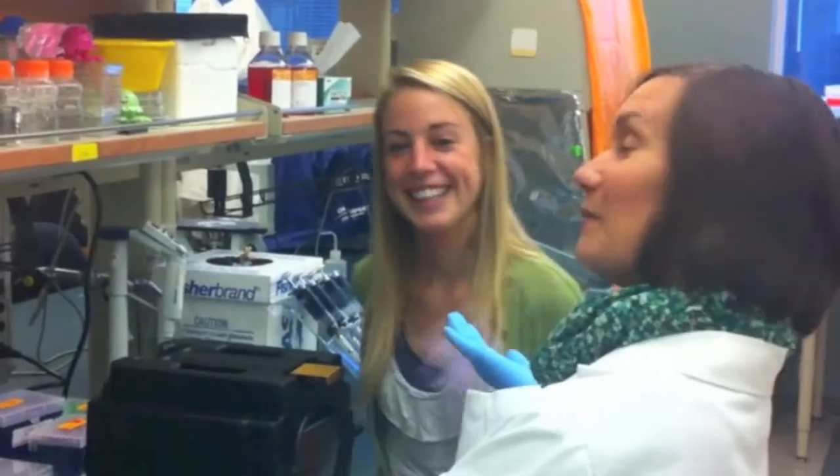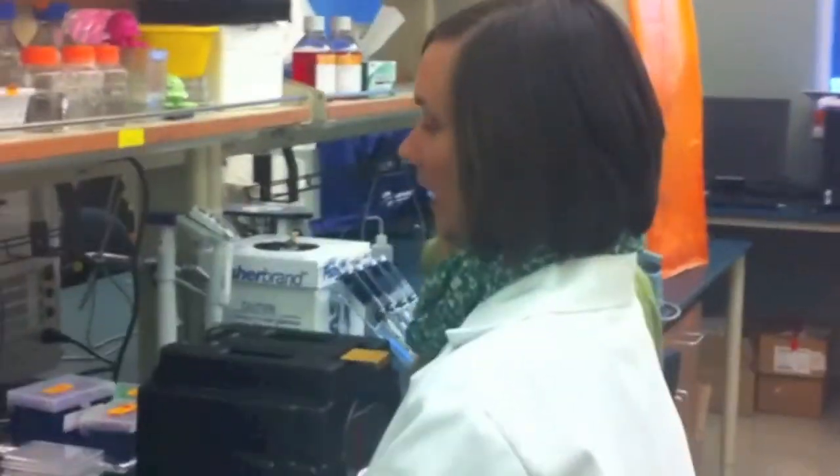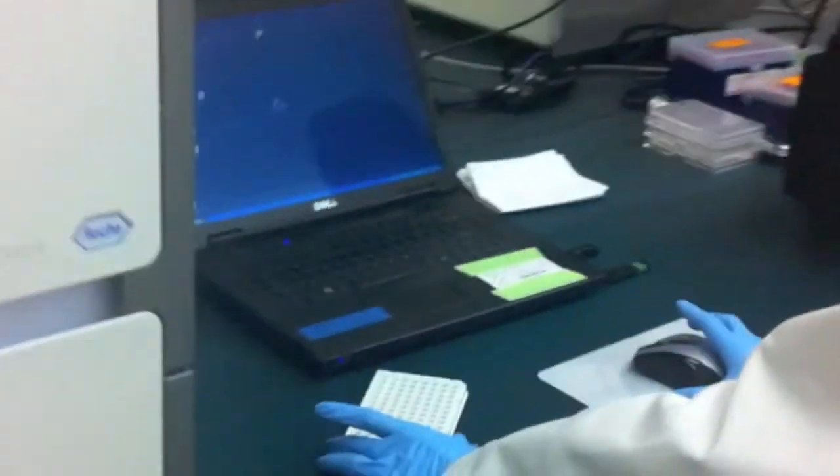Hi, I'm Lindsay. This is Emma. And today, we're going to learn how to start a 96-well plate in the Roche Light Cycler.